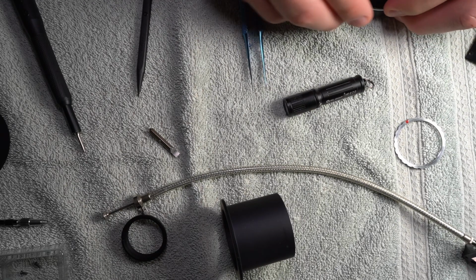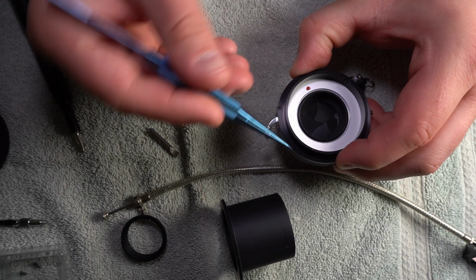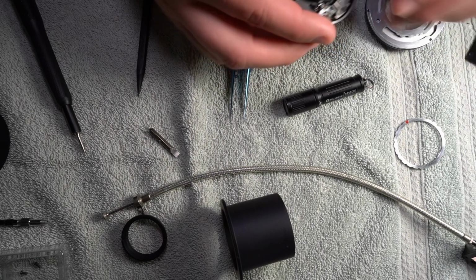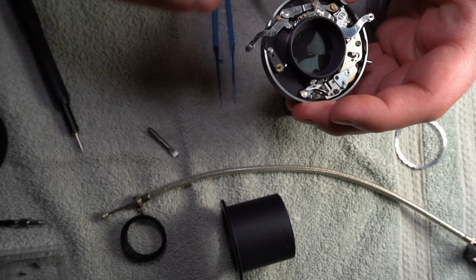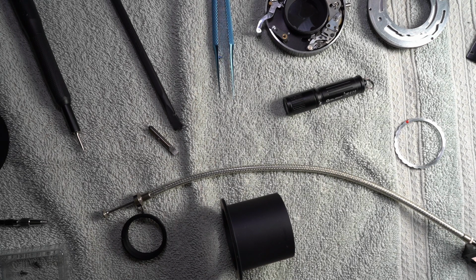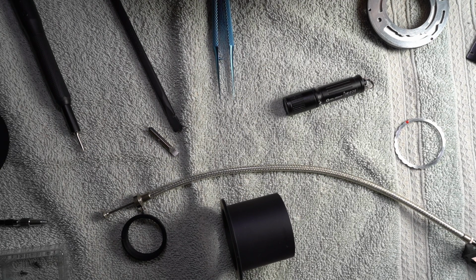There. Okay. I'm not going to take that apart to show you exactly what happened, but basically over here there was a thing that's spring-loaded out on detents on this thing. And I'm actually going to do that because it's an important part. This part right here is spring-loaded out, and it's actually a pretty decent spring. I have to oil that, because I think that's important. Don't need that much grease. I just need a little bit. After all, it is an incredibly tiny part.